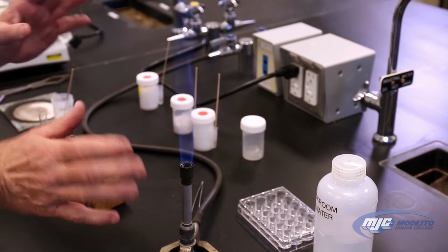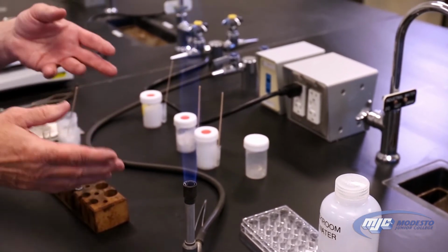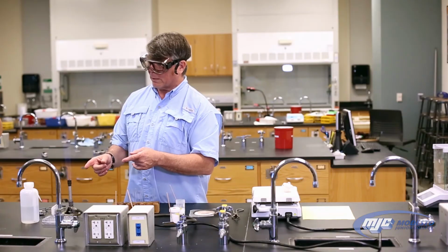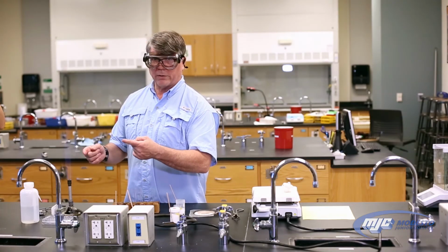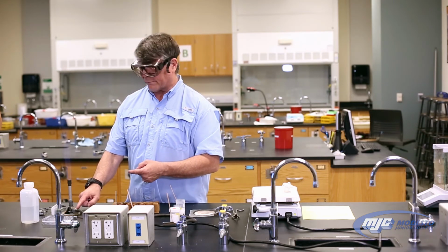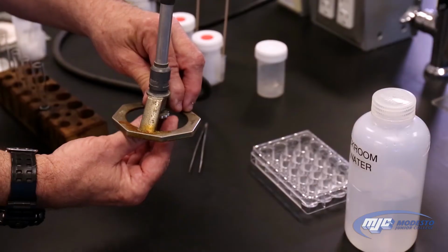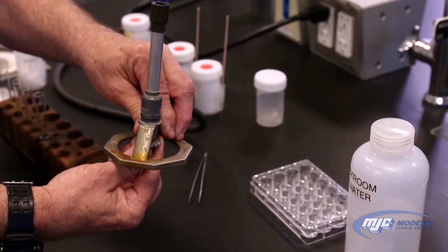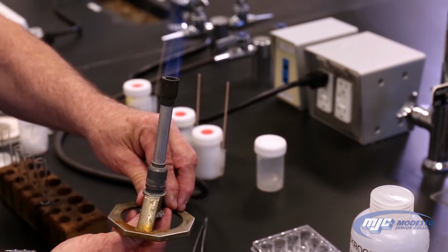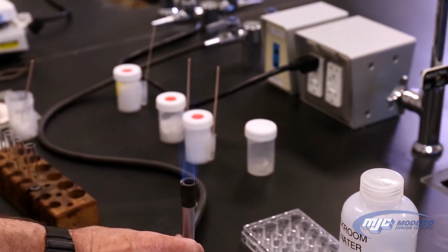Now, I can tell I need to adjust that flame. To me, that has too much fuel, maybe not enough oxygen. So the first thing I'm going to do is reduce the amount of fuel that's getting to the flame. And that's that knurled handle, the needle valve on the bottom of the Bunsen burner. It's hot up here, but it's not going to be hot down here. So I'm going to turn this in and get that flame right there. And that's a pretty good flame.